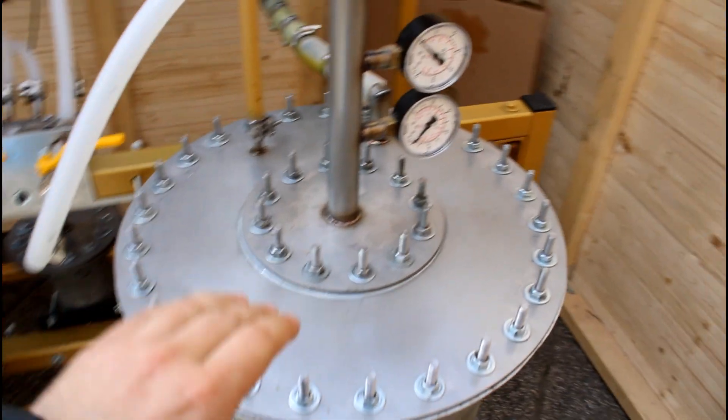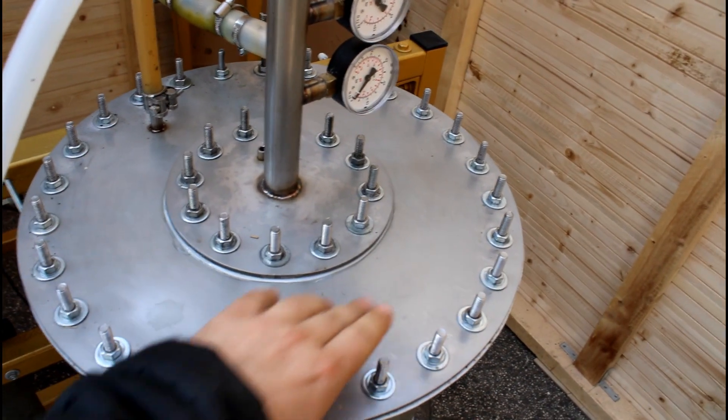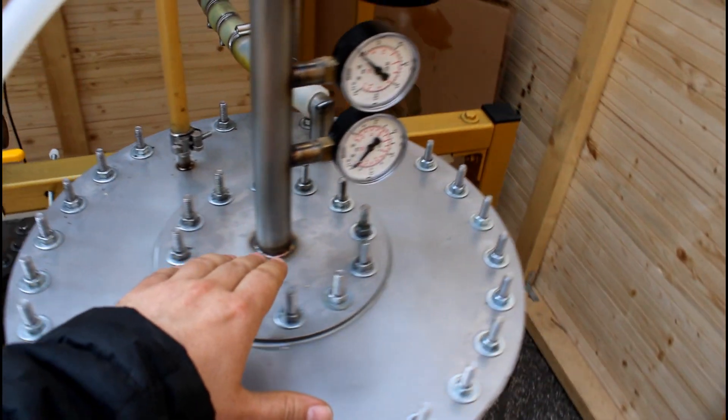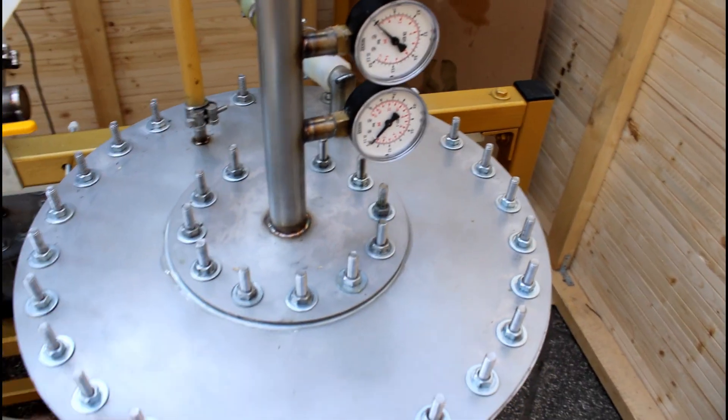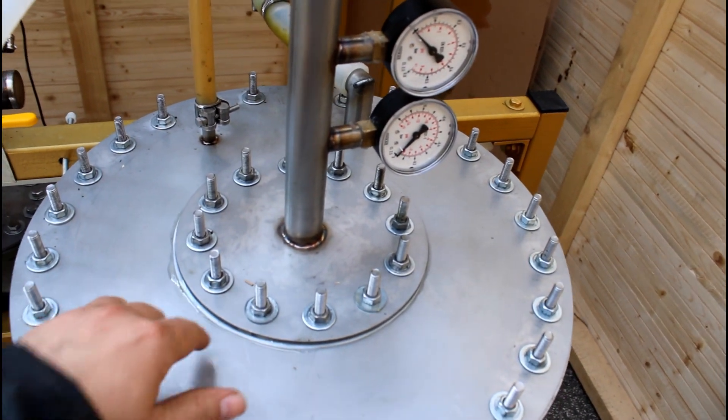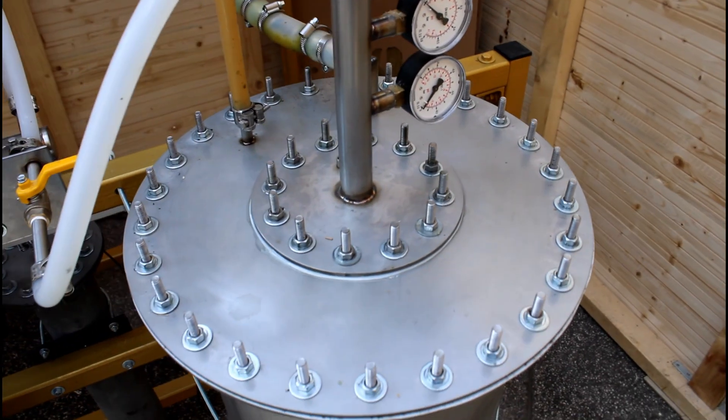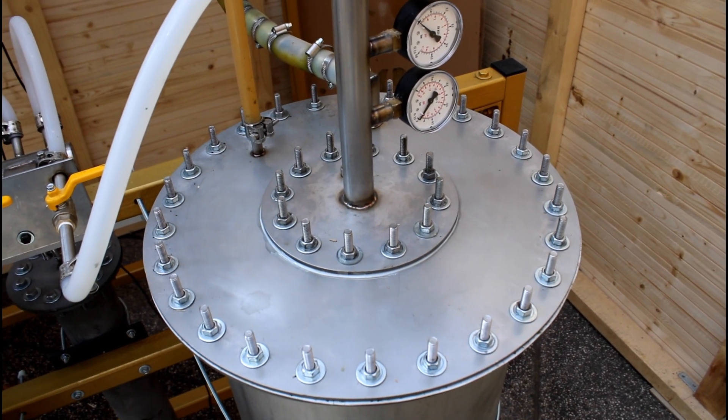I can dismount the top lid. I can, or I have to, dismount this thing here. They are having Teflon sealings. And this works actually pretty good to keep it tight from the bottom.